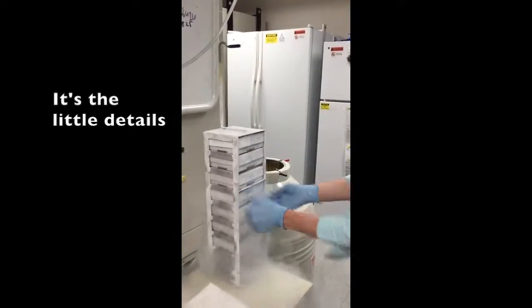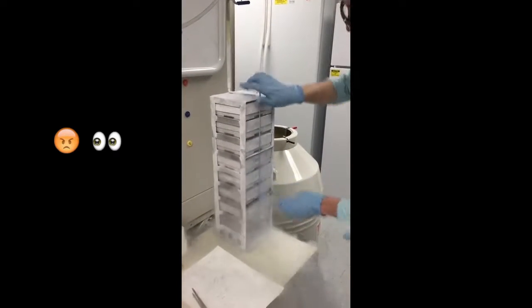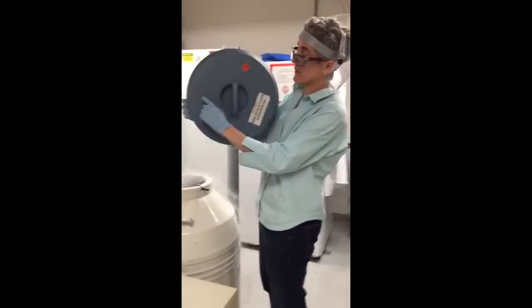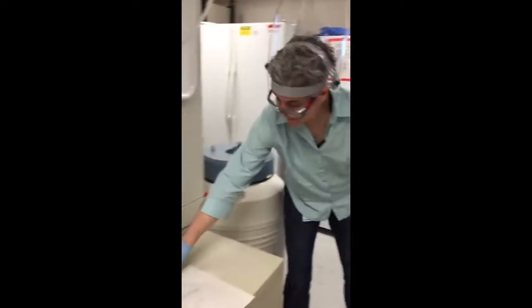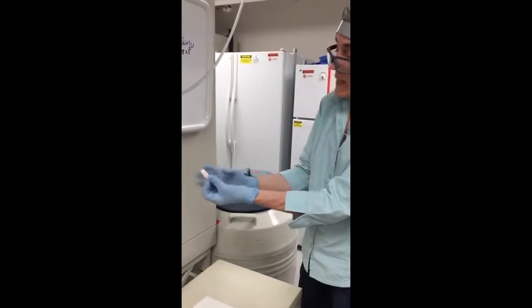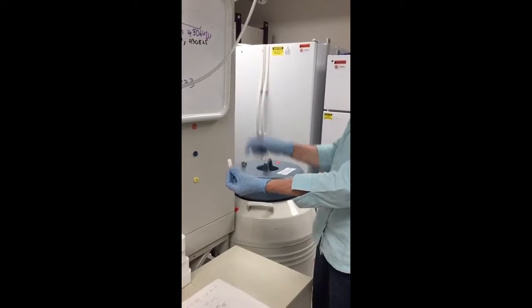Now I'm going to make sure 'front' is right on top of 'front'. Put stuff back. Put this in — or you're going to be in big trouble. Put my face shield back down. Put it back in with the cane in there. We're going to line up — there's a little slot right here, line this slide up right here — and put my lock back on. We have to keep it locked up. I'm going to make sure it's tight all the way down, and I'm not going to hold the end or point it at my face or anybody else, because there could be liquid nitrogen stuck in there and that could turn into a bullet.